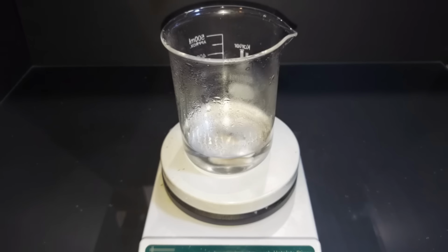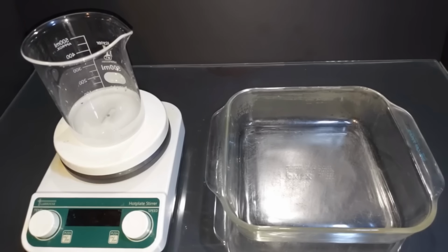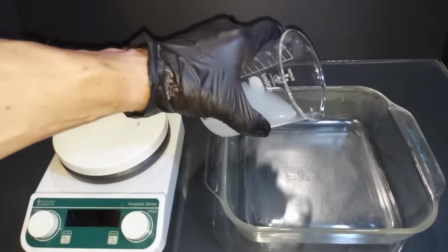And then once it's at room temperature, I'm going to pour it into a flat Pyrex dish and we'll put it in the fridge to crystallize our potassium oxalate. Here's a glass dish I was talking about. As it's cooled down to room temperature and now sat for, I don't know, 5 minutes as I got this set up, it's already started to come out of solution, which you can clearly see it's white on the bottom. So I'm going to go ahead and very quickly transfer this. It's just a lot easier to get the crystals out of this glass dish.